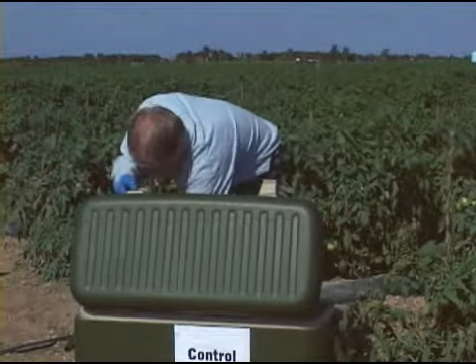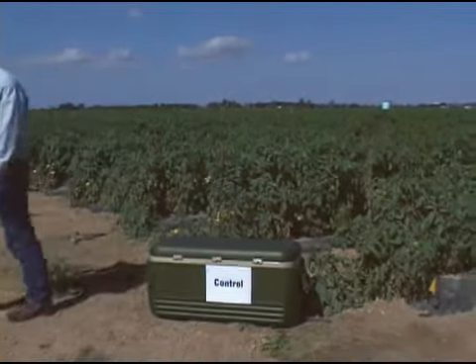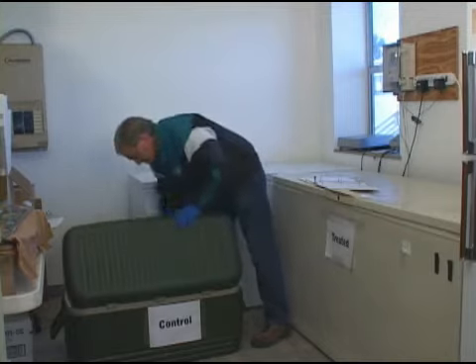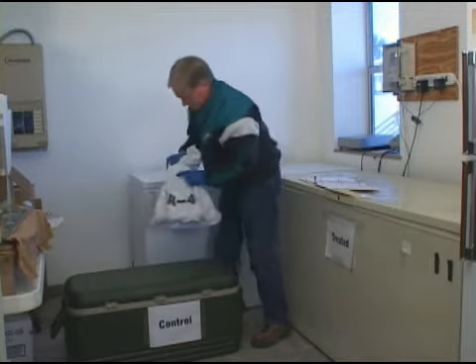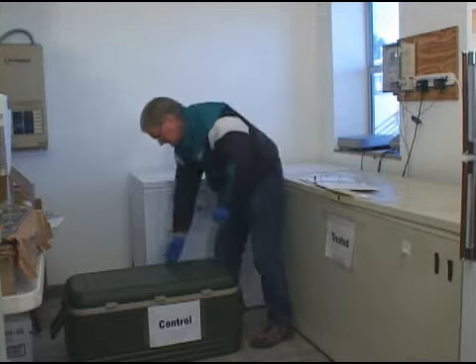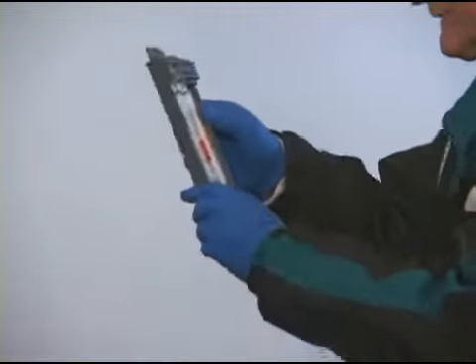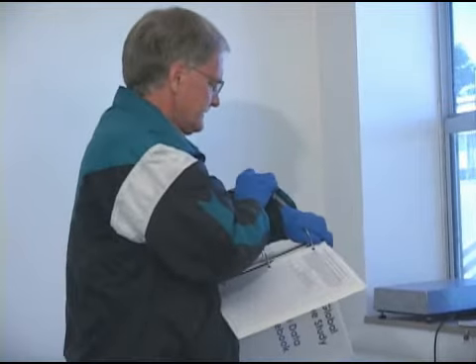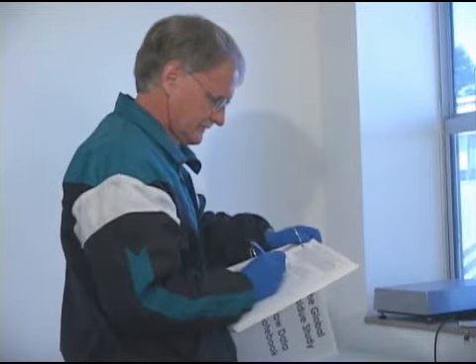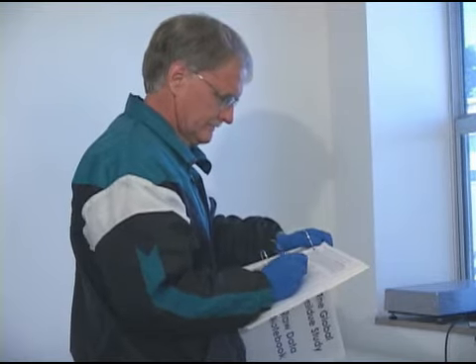Place the 4 sample bags you collected in the untreated control sample ice chest until you can put the samples into a freezer. Try to put the samples in an untreated sample freezer as soon as possible. It is very important that your freezer is set at a temperature less than -15 degrees Celsius, and preferably less than -20 degrees Celsius. Examine your freezer before you start sampling to be sure that the freezer is at the correct temperature. Continue to monitor and document freezer storage temperatures every day until the samples are shipped. Use continuous temperature monitor devices if available.